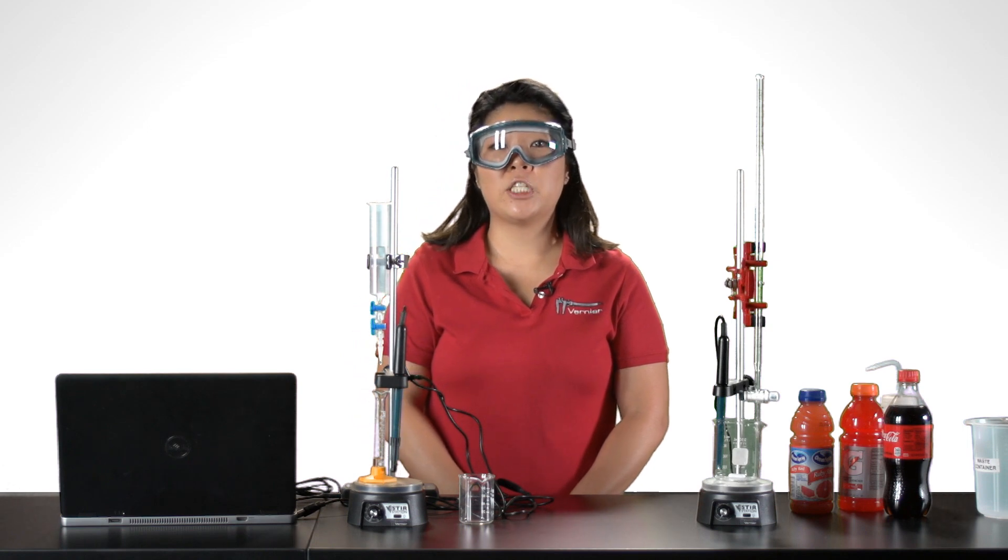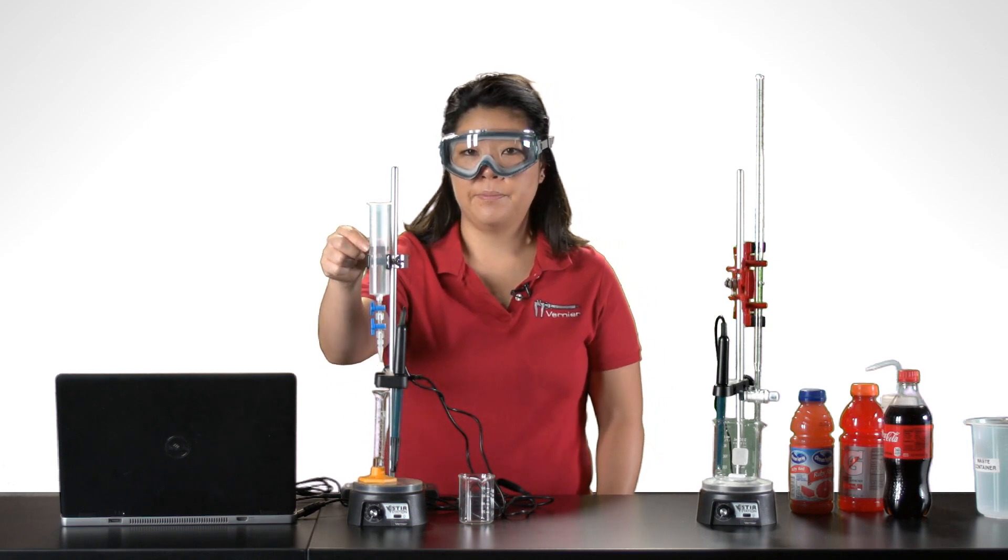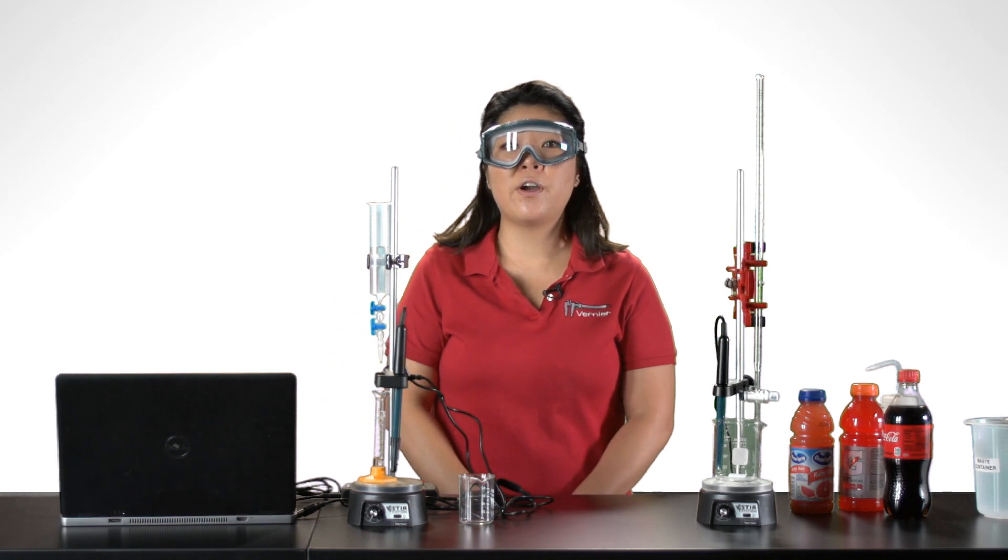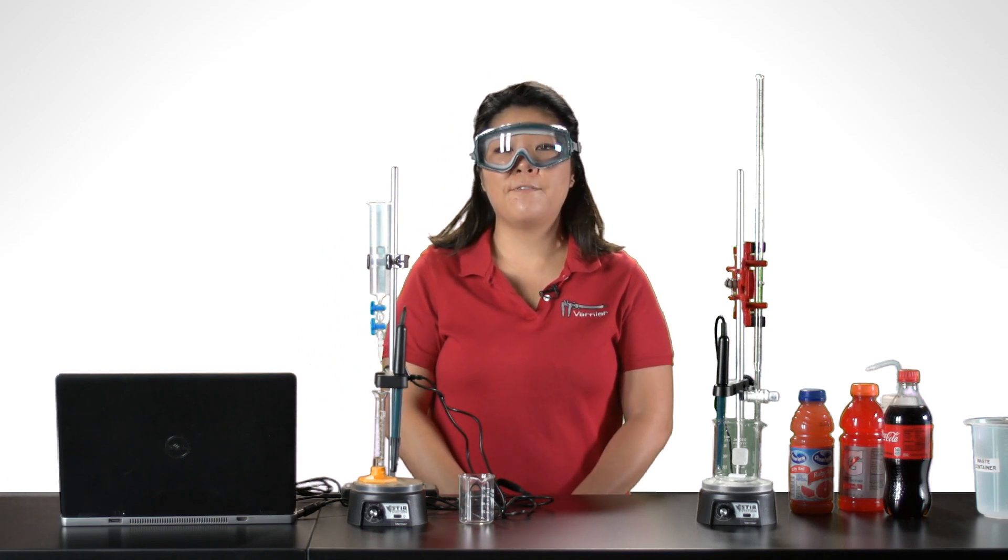The calibration corresponds to the reagent reservoir. Be sure to use the same reagent reservoir for the calibration and for the investigation.